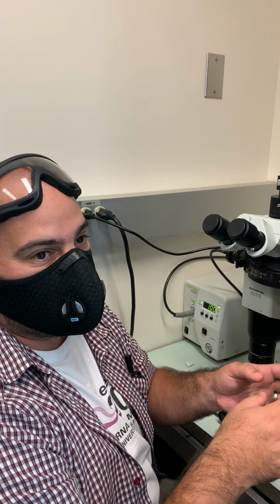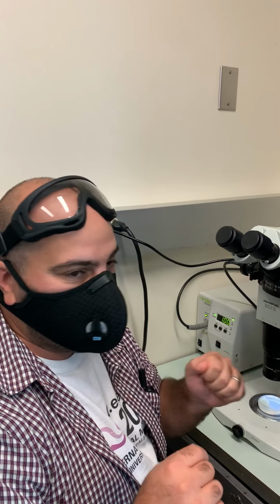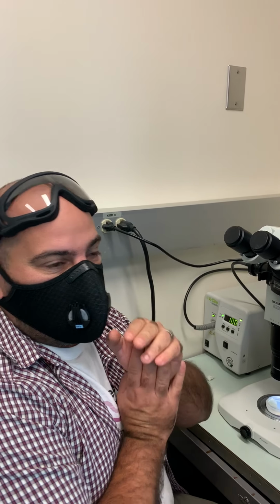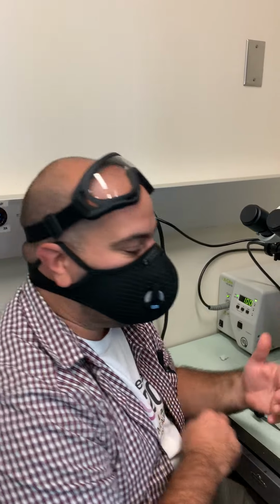So save it to the desktop, and once you're done making your movie, cut that file and paste it in your hard drive that you can detach, or on the lab drive, which is what we store our information. But do that afterwards. Make sure you don't leave those files on the desktop, otherwise you're gonna clog the computer and it's gonna fill up.